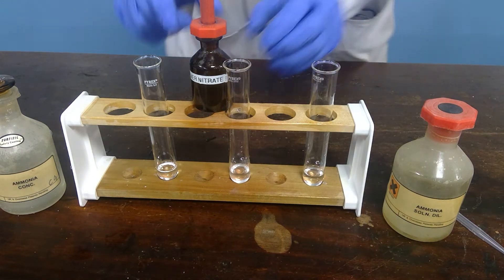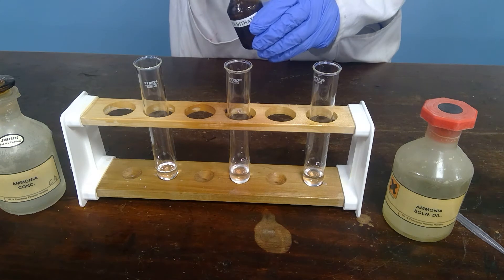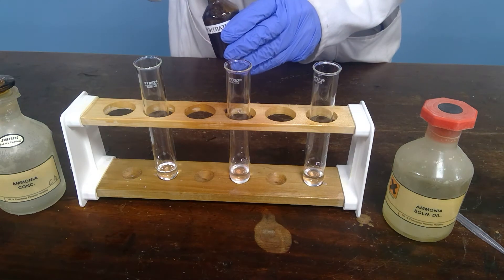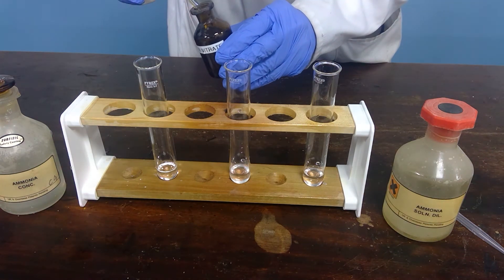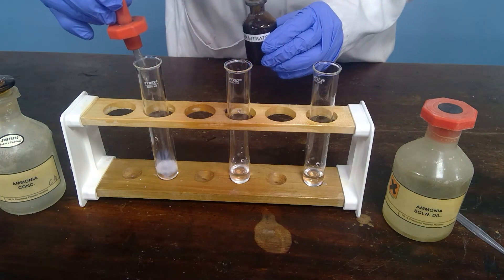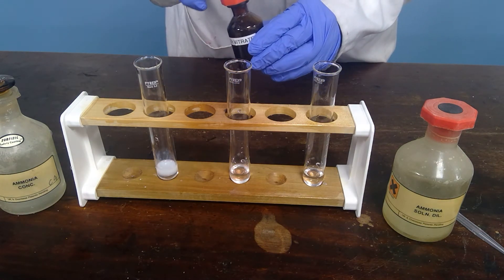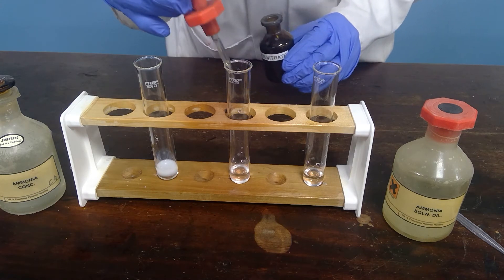So to each one of these, we add some silver nitrate solution. The silver ion combines with the halide ion to form an insoluble silver halide. So the first one would be silver chloride, described as a white precipitate.